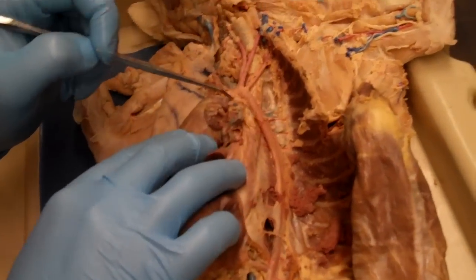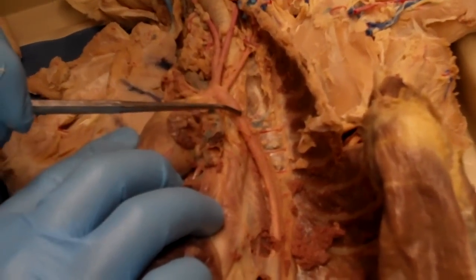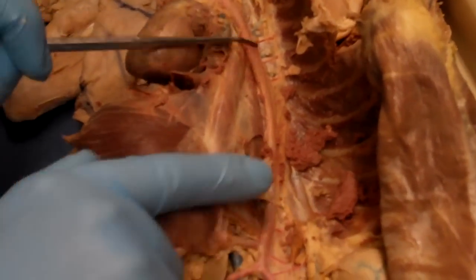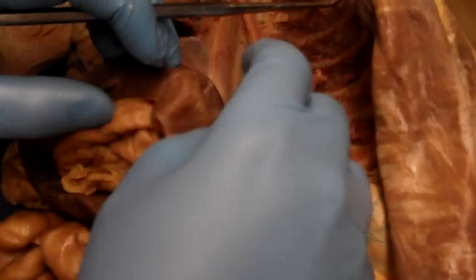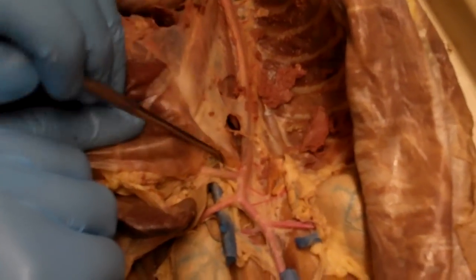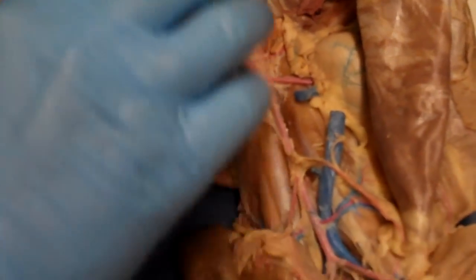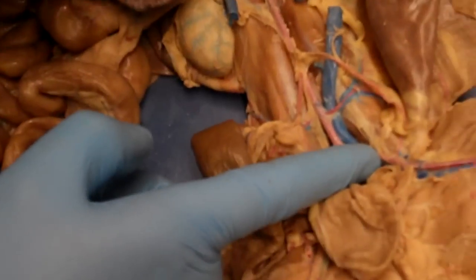Okay, so if we're looking at the heart, we have the aortic arch coming out of the heart. It's going to do this 180-degree sort of U-turn, and then it's going to continue along the thorax as the thoracic aorta. Right at this little bend right here, which roughly, if we put the diaphragm back in its normal spot, is where it crosses the diaphragm, it'll stop being the thoracic aorta and then continue on as the abdominal aorta. So we have the aortic arch into the thoracic aorta into the abdominal aorta.